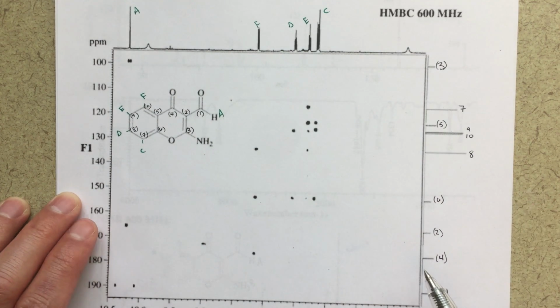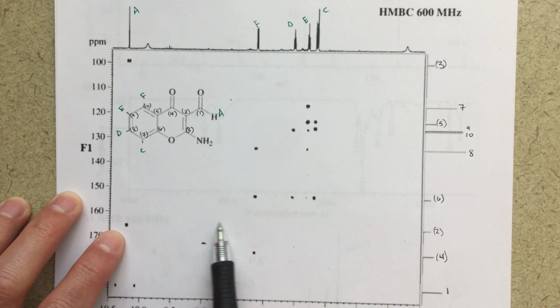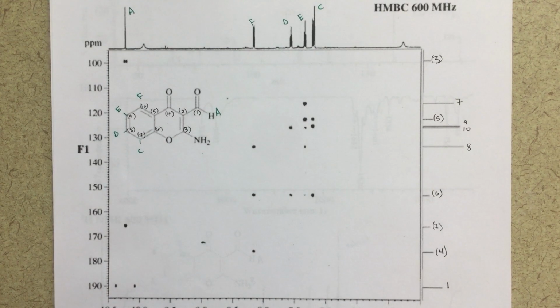number 3. And then here, so number 3 here, and then here, number 2, that's going to be this proton here, which we've got another correlation, maybe a little bit stronger than we might like to see, but definitely within the realm of reason. So that's how we're going to analyze our HMBC. And now we're pretty much done, right? We've got most of the labels in.